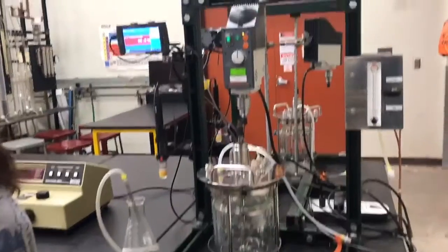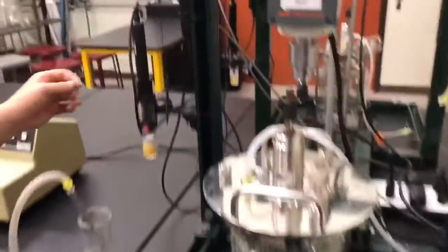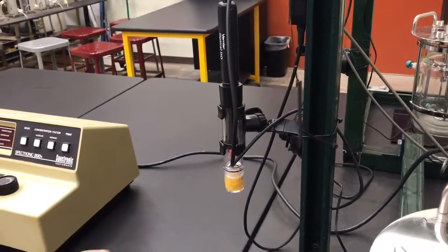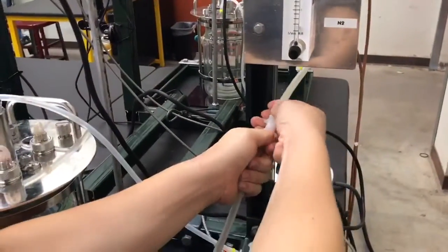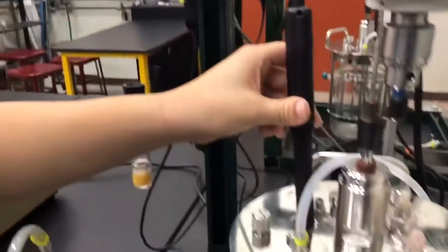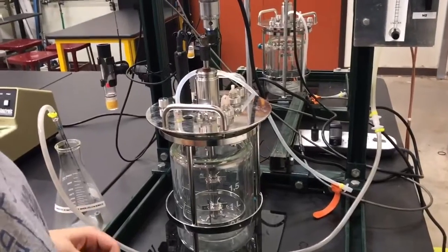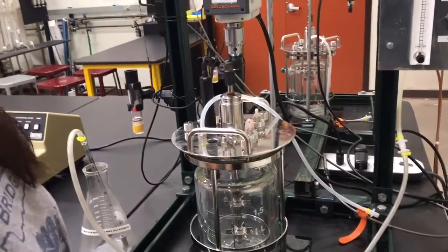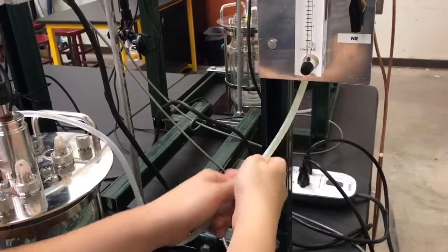For the dynamic method, the reactor is filled with two liters of yeast media prepared previously. Because this is a cell culture, calibrate the DO probe in pure water: fill a flask with pure water, attach airflow, turn the air on, place the DO probe in the flask, and follow the same LabQuest calibration steps. Once calibrated, place the probe in the reactor and add anti-foaming agent before agitating, since yeast will foam up and overflow without it. Then reattach airflow to the reactor and turn the air on.